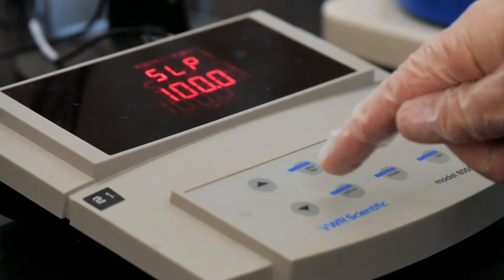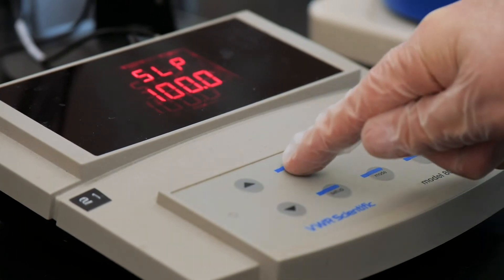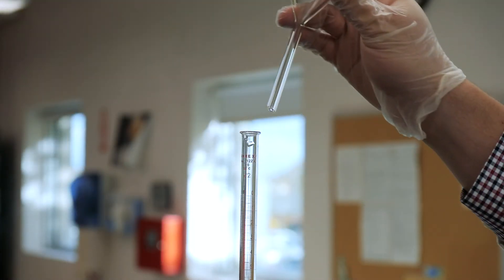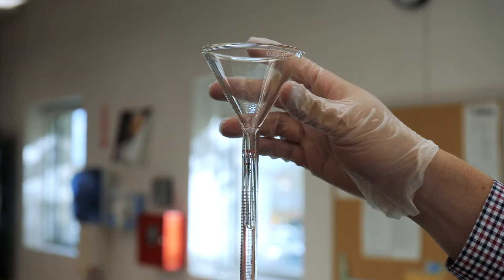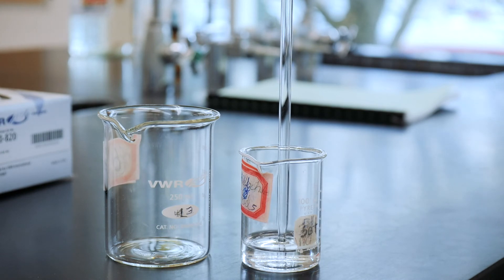Press Yes to accept, and then Yes once more, when the screen reads SLP100. One more Yes, and we're all done and ready to use our pH meter. The burette and pipette that you'll use today must also be cleaned before starting. See the appendix in the back of your lab manual for more details on that.